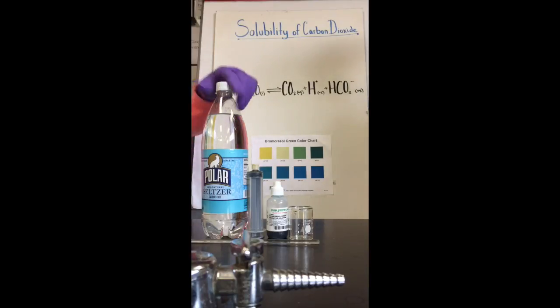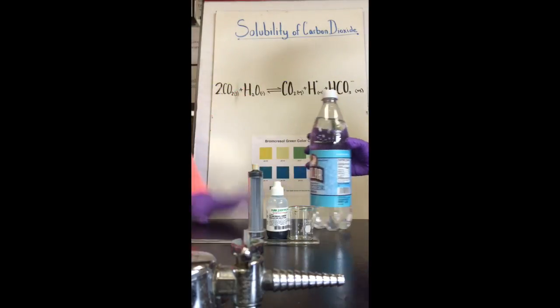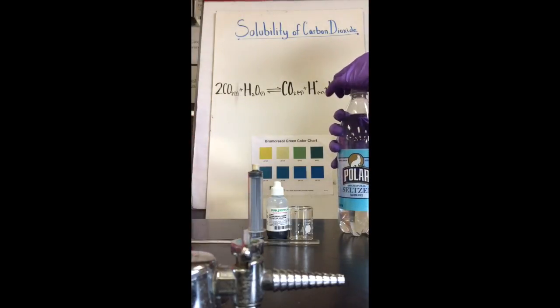So now Martha's going to take some of this seltzer water, which has the carbon dioxide dissolved in it to make it fizzy, which is also called carbonic acid. She's gonna pour about 10 milliliters in the beaker.